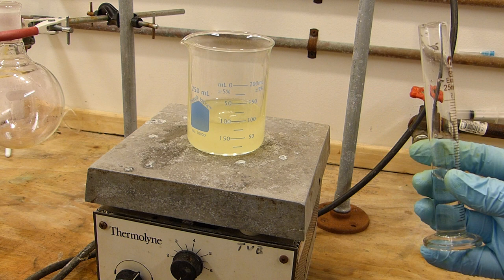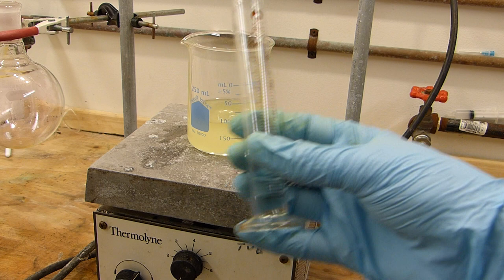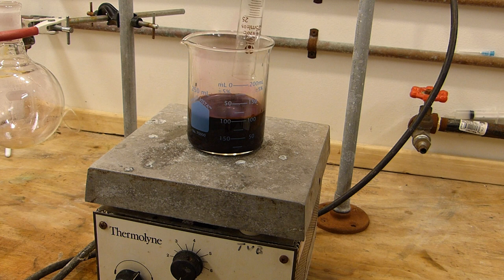Otherwise if you're really anal about it you can cool this in the refrigerator and this as well and then add it together slowly or something like that. Honestly there's no need for fancy glassware. We'll just pour it.